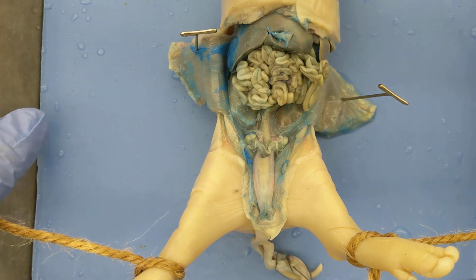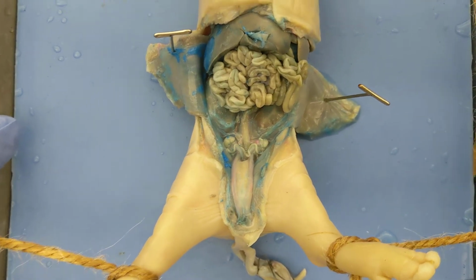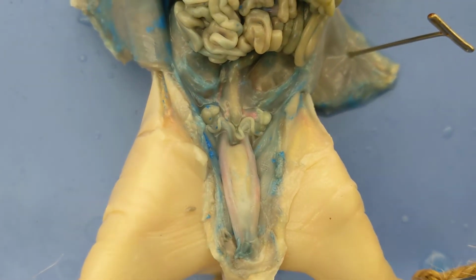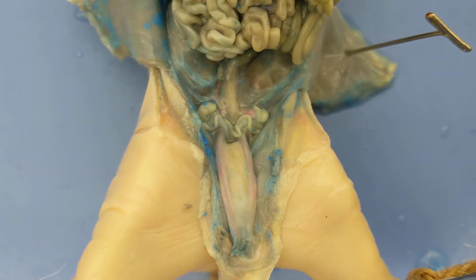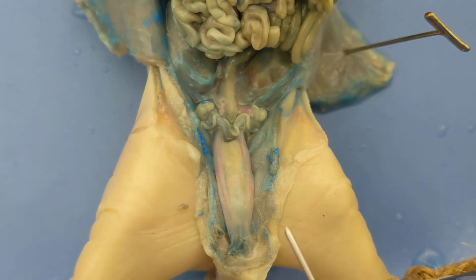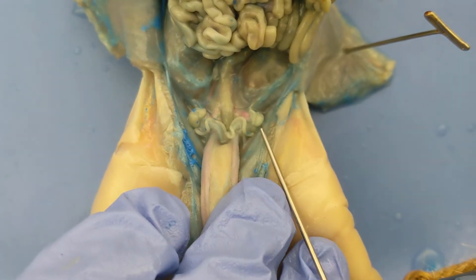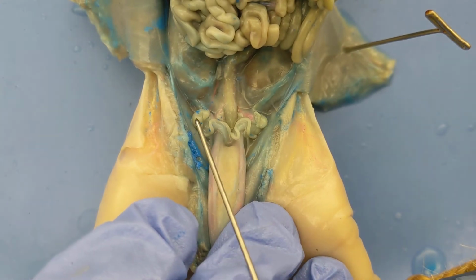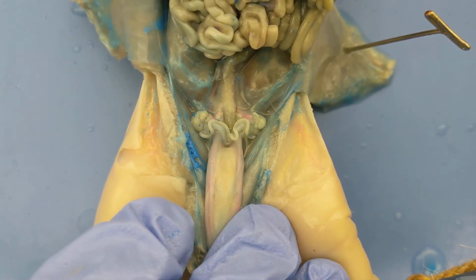Now let's talk about the reproductive system for a female pig, the internal structures that we'll see. I'm going to zoom in here, again into the posterior region, this time into the abdominal cavity so that you can see some of the structures here. I'm going to use my probe to point them out. So our female pig here has 2 ovaries. There's one right here that my probe is touching, and there's another right here that my probe is touching.